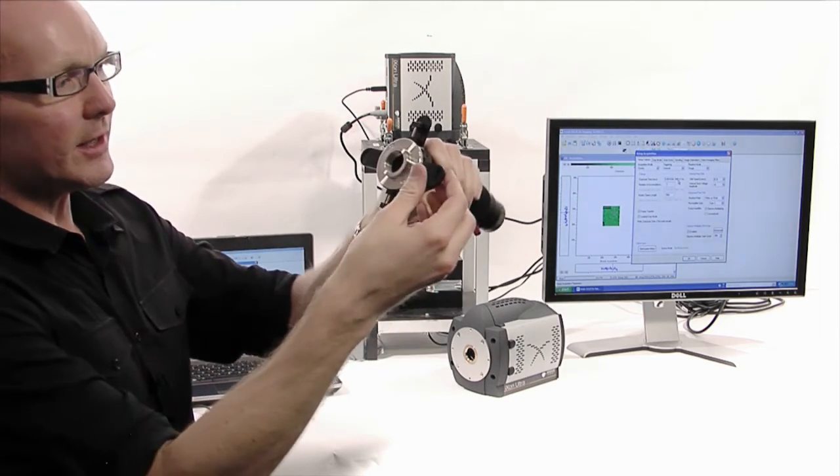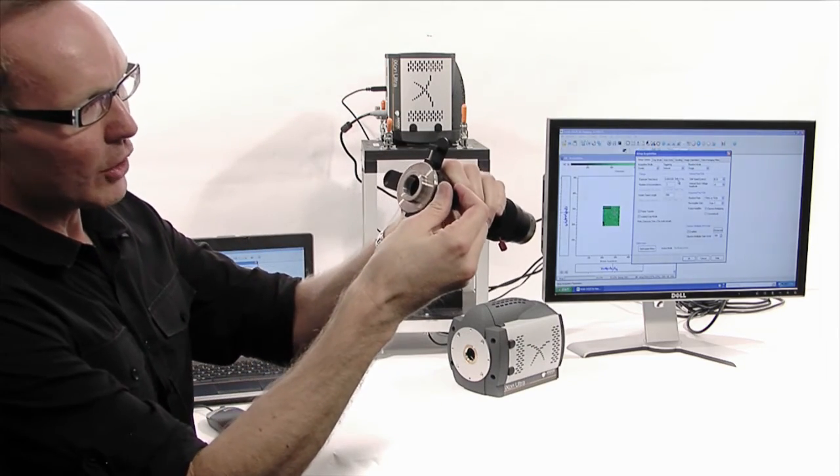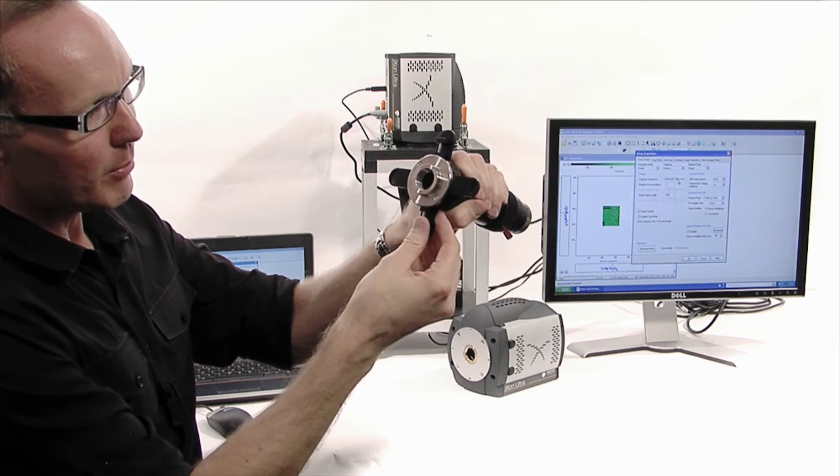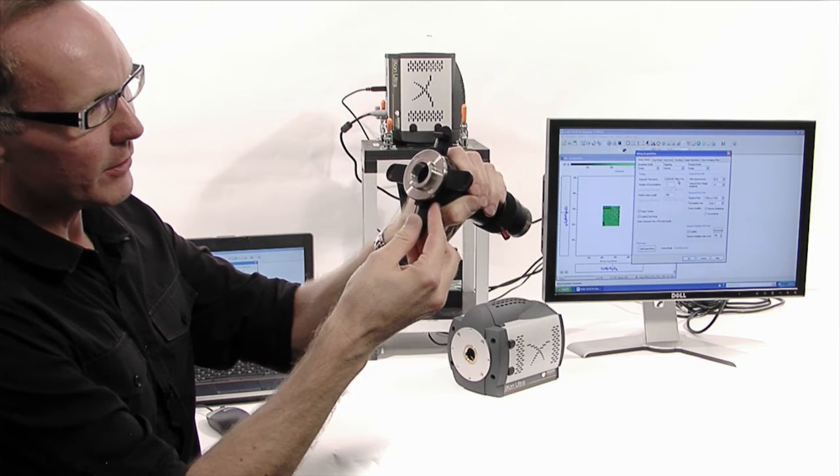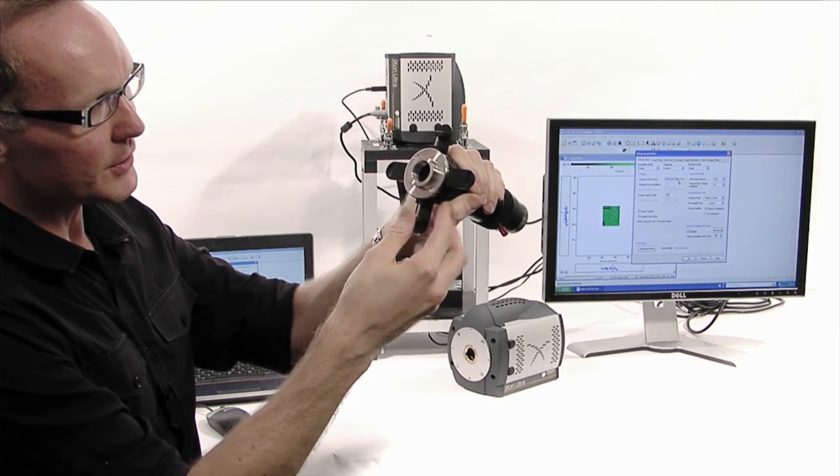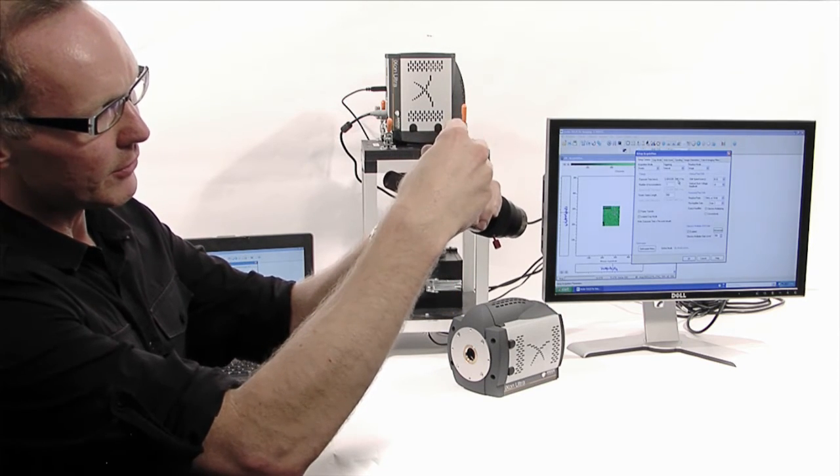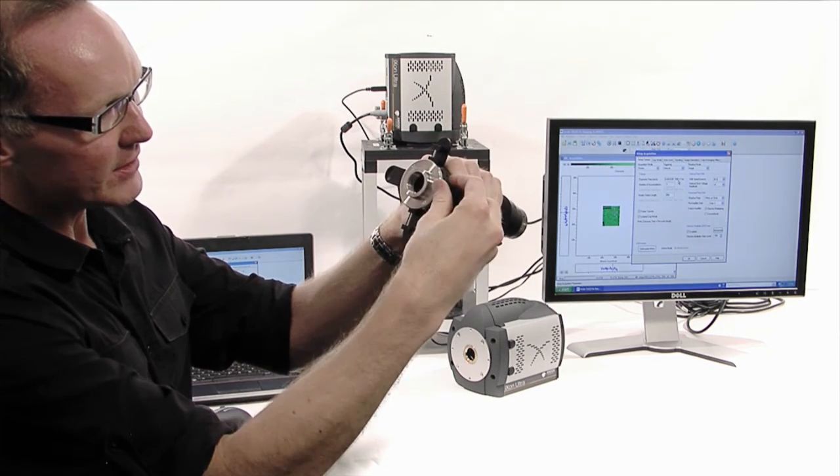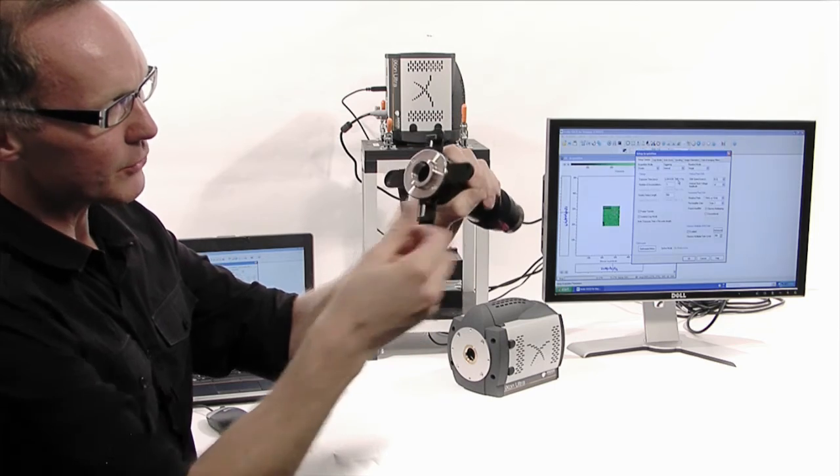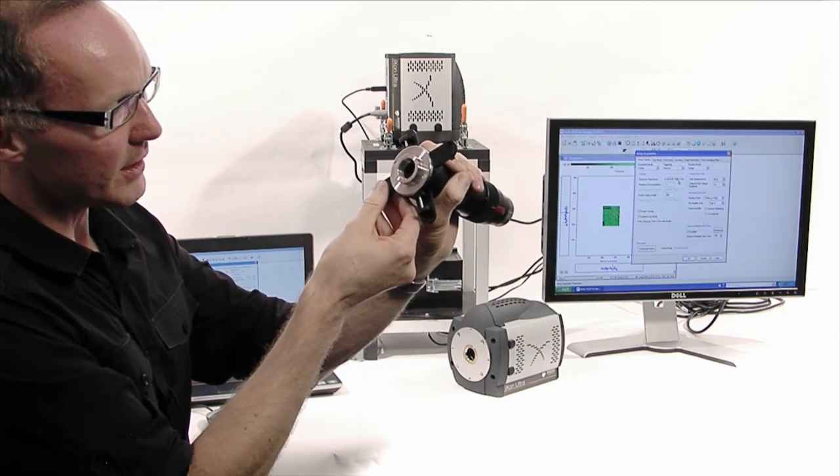Here you will see a couple of simple blade adjusts. They're very smooth action. You can define physically the region of interest that you want to see.